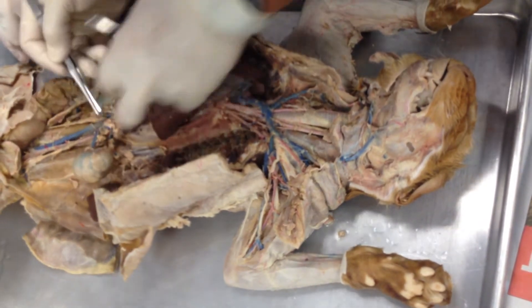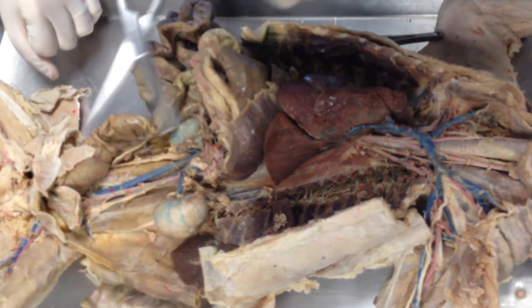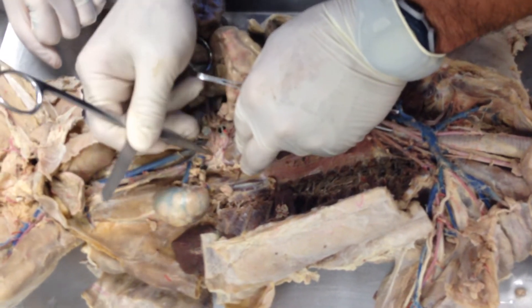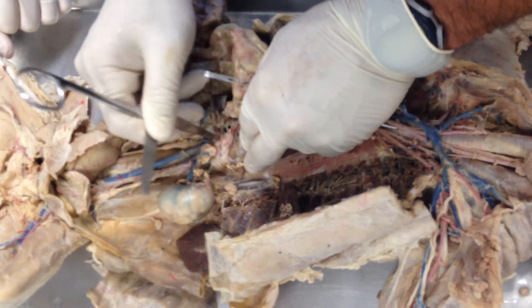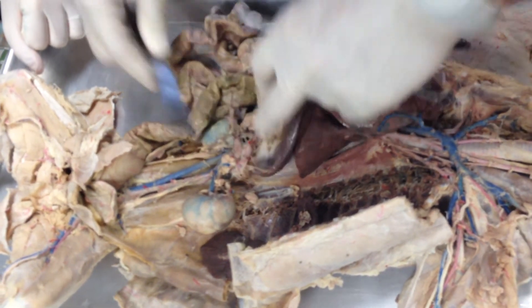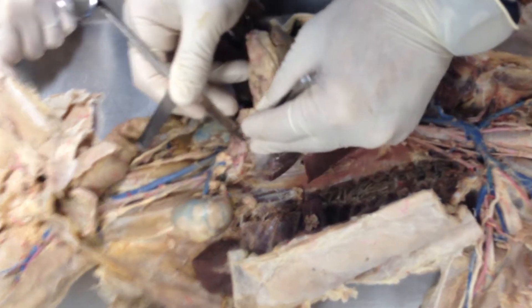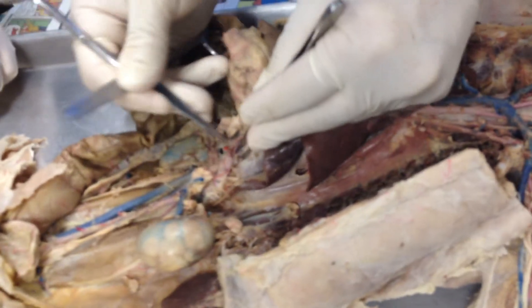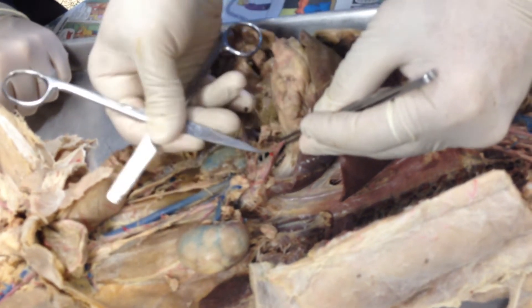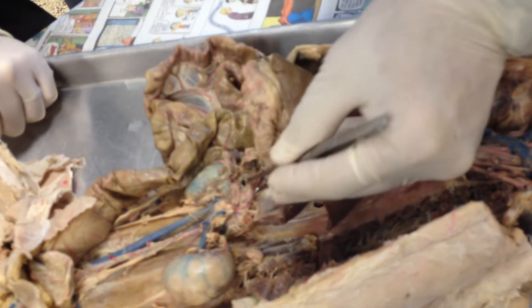Continuing down into the abdominal cavity, the first landmark after the diaphragm is where two big arteries branch off. The first one is the celiac artery, which has three branches: one that runs under the stomach to the liver called the hepatic, one that runs to the stomach called the gastric, and one to the spleen. Those are the three branches of the celiac artery.